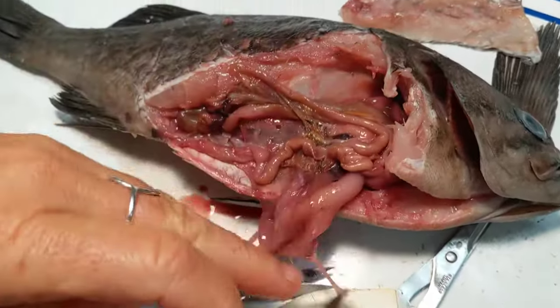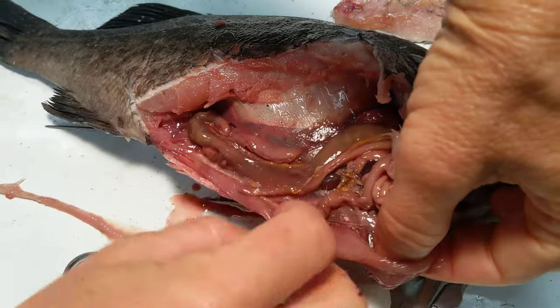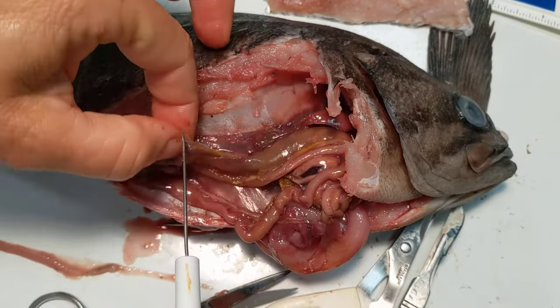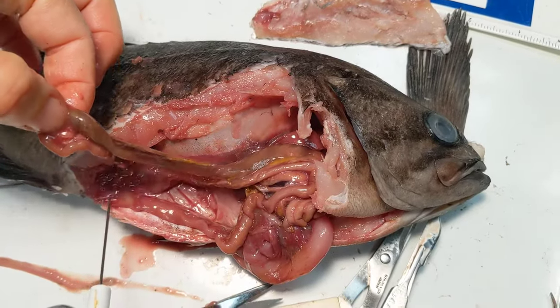You can see that it flows down to the intestines. If you follow it, you can see this darker intestine where the more digested stuff is. And then it was just connecting to the anal opening there.